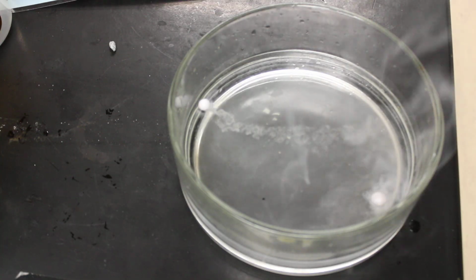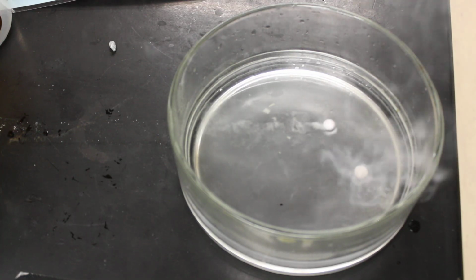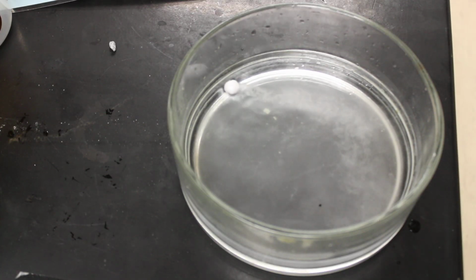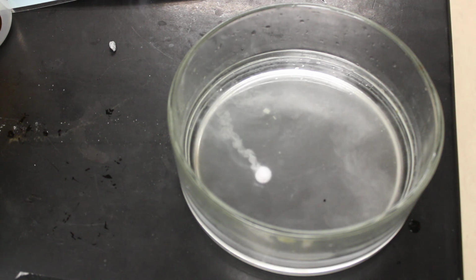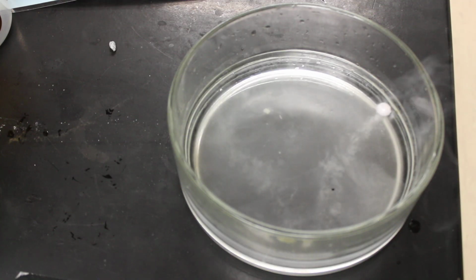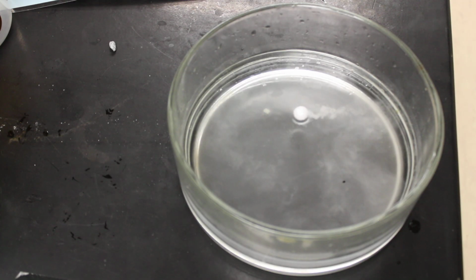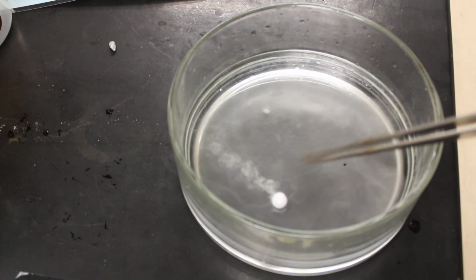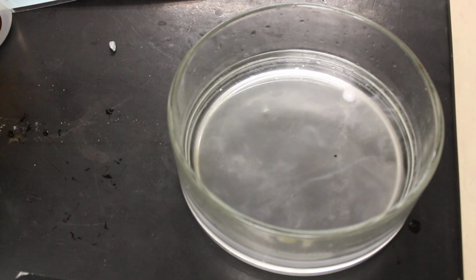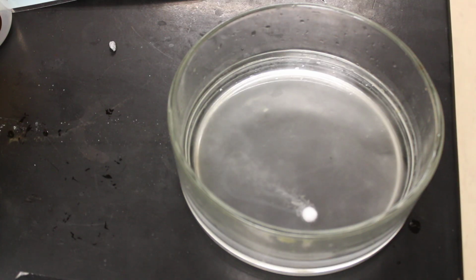And they're cranking away there. Now, see, when they touch together like that, they merge into one ball, and now they're cruising around, bouncing off the sides and reacting. It'd be kind of an interesting little trail in the water as they go there. And again, we're just turning the water basic because we're taking some of its hydrogens and releasing it out there as that gas.